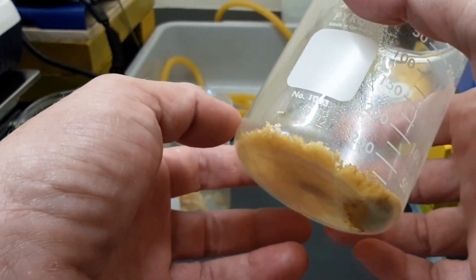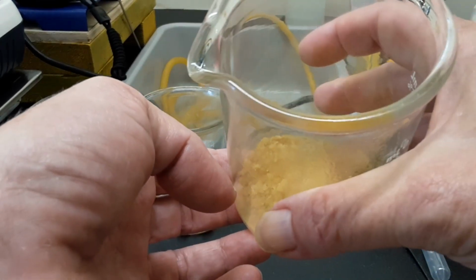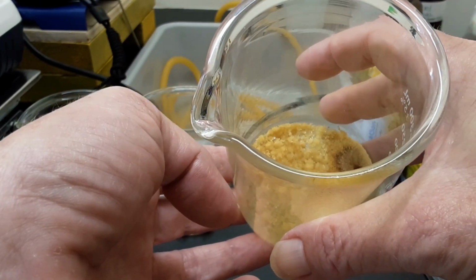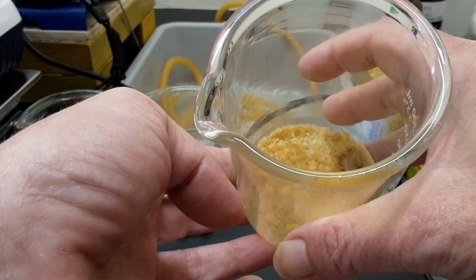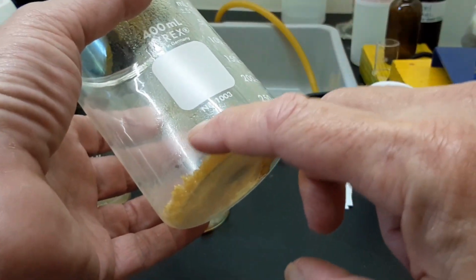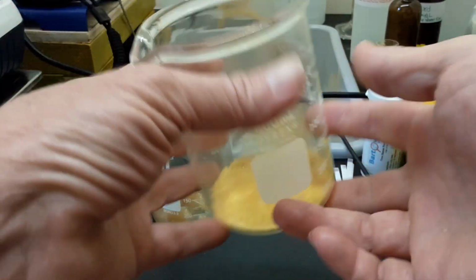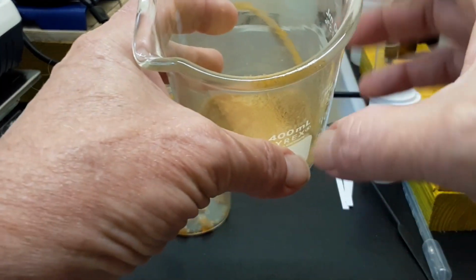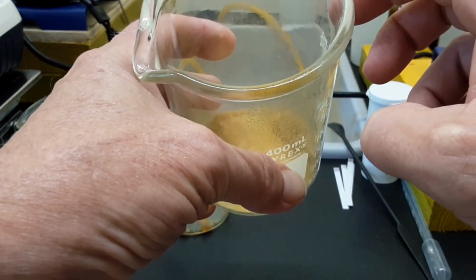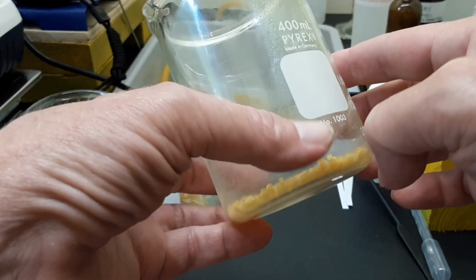But I messed up pretty bad on this one, because what I did was I started to precipitate the piperine out of solution with hot water by pipette prior to adding in the potassium hydroxide solution. And of course I got this bunch of really sticky yellow mess all over the sides of the beaker. And there was this big huge clump of separated white in the solution that looked like it could have been fats or lipids, or man, I just don't even know.